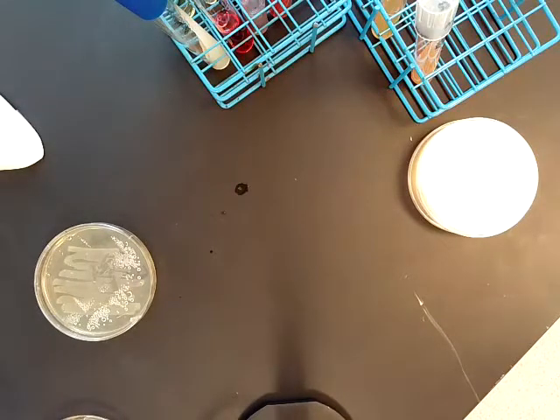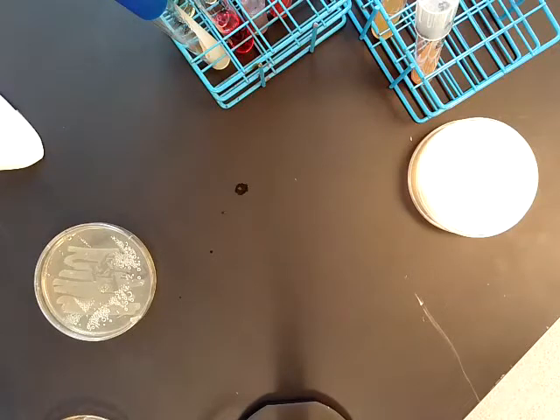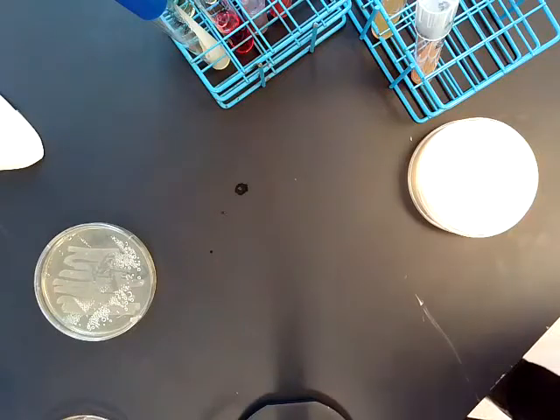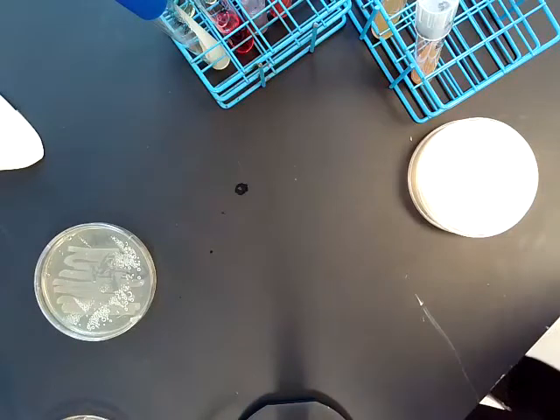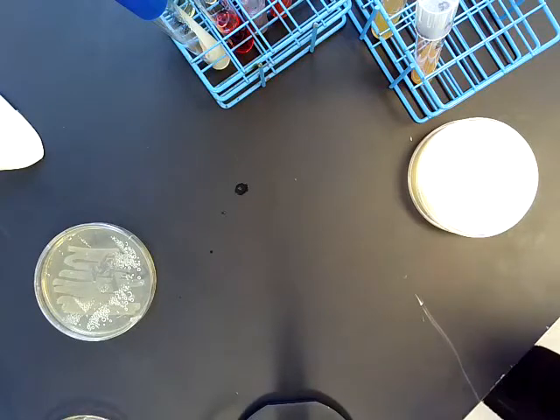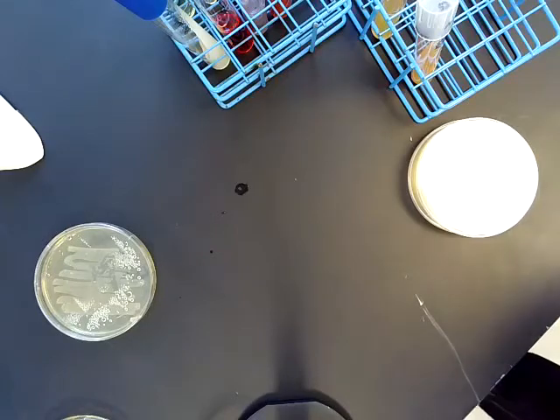In this video I'm going to talk about hydrolytic tests. Hydrolysis is the breakdown of a substance using water — 'hydro' means water and 'lysis' means to break apart. In hydrolytic tests we're looking for the presence of an enzyme that can break down what we're testing on.